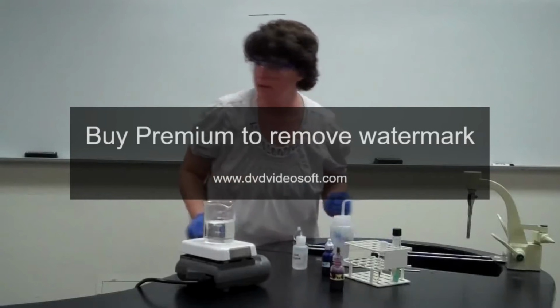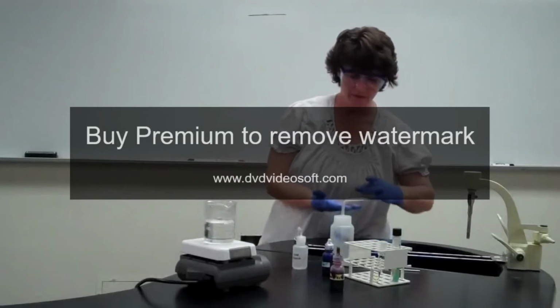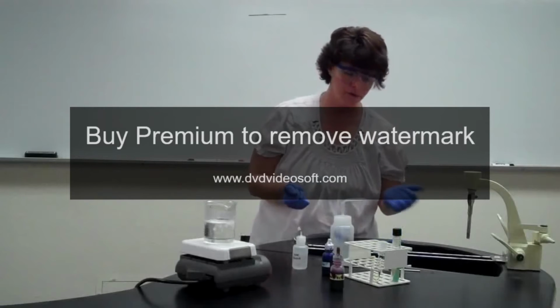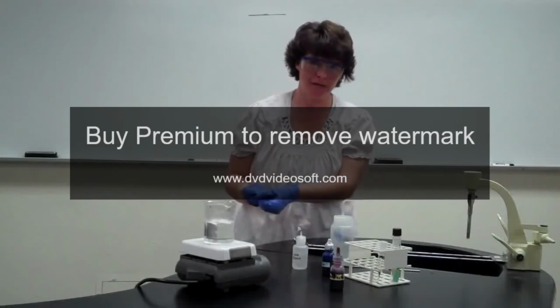And now that we're done rinsing, we can grab a paper towel, which I seem to not have, so pretend I had a paper towel. You would blot the back like we did before, and gently blot the front, but don't wipe your smear off. You don't want to waste your last 10 minutes of work. So that's the acid fast stain. The next stain that you're going to learn is going to be the endospore stain.